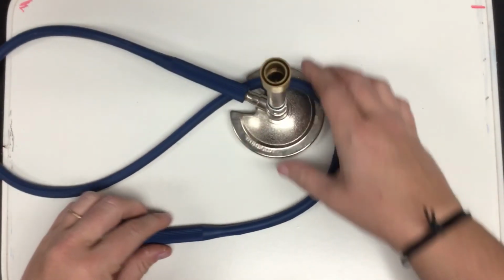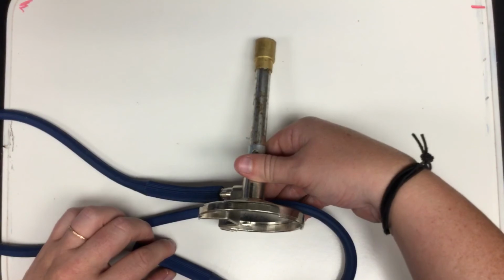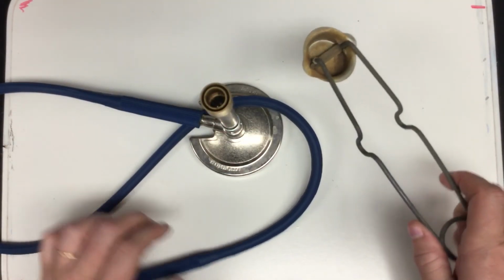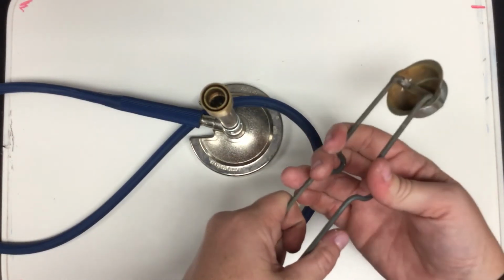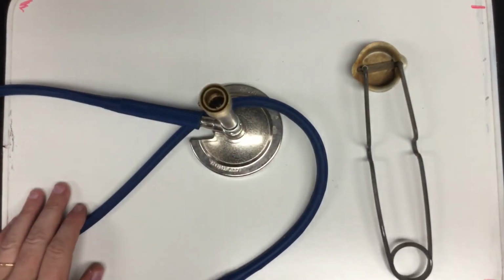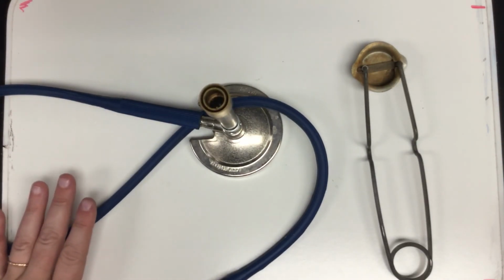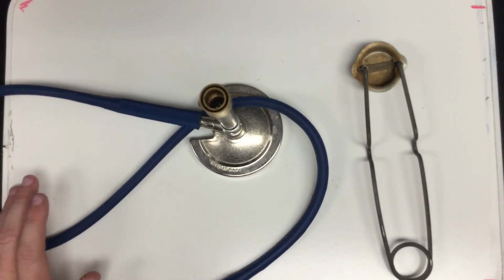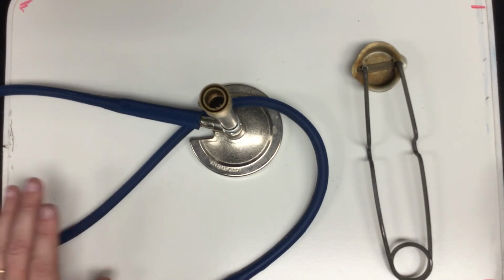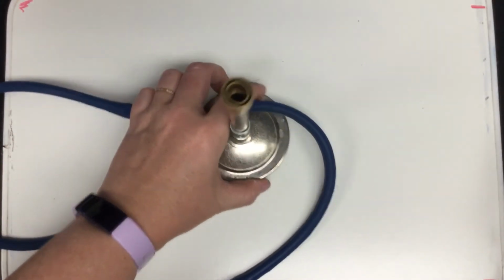And finally, we have our Bunsen burner and the striker that we use to light the Bunsen burner. And throughout labs this semester, you'll get plenty of practice sparking this in order to light the burner up. Those pieces of apparatus are the most common ones we will be using. That's not to say that that's an exclusive list, that it includes everything, but it does include the ones that you should be able to immediately identify and take out of your drawer when asked.